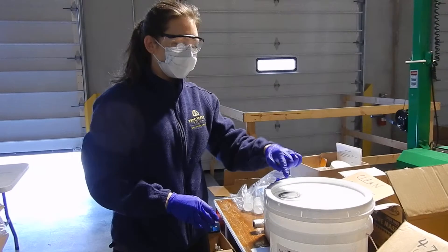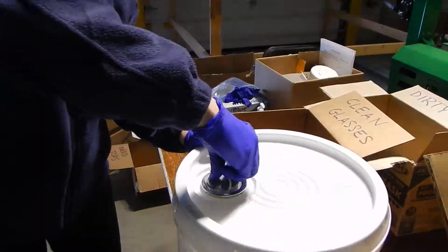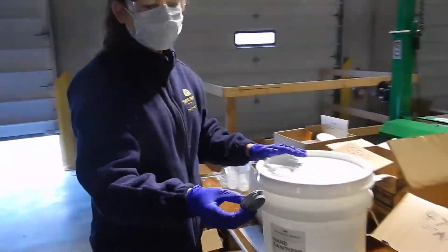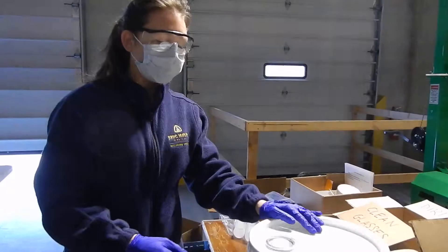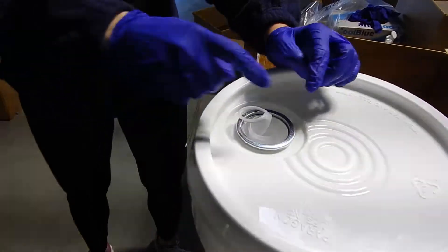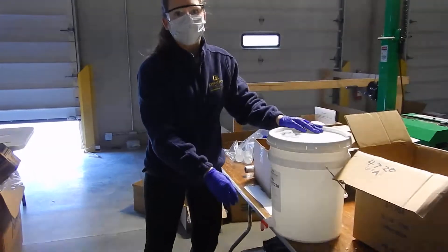When you get a new bucket, if the top is closed, you need to pull up the tab of the gray part and twist it off. We keep these gray pieces — you can put them in the box over here. Then we have a pull tab, so simply pull it back. This allows some air so that when it comes out the bottom, it'll be a nice smooth flow.